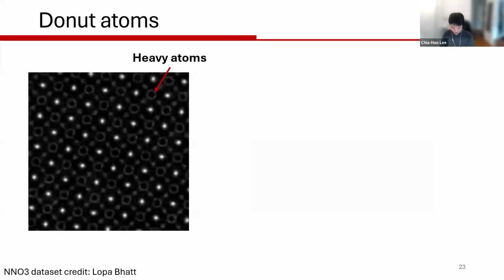And another common object artifact is the donut atoms. Some people call them the crater artifacts, or the black hole in the images. It typically happens when you have a heavy atom like bismuth, and this one I think is neodymium atoms from a data set kindly provided by LOPA. You often see these black hole or donut artifacts at these heavy atom sites, even on simulated data sets as thin as 2 nanometers.